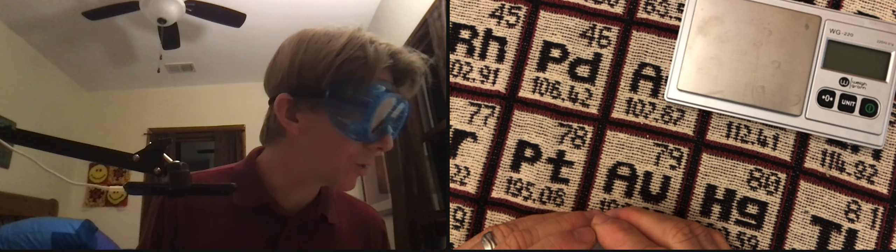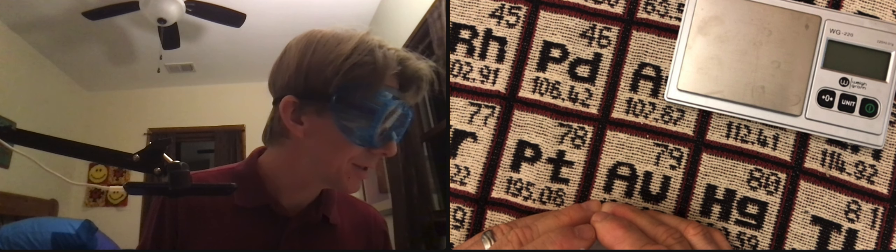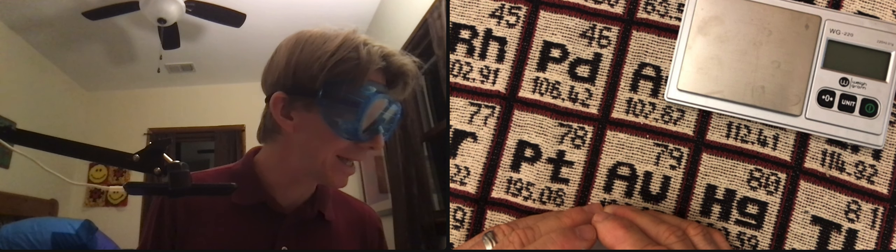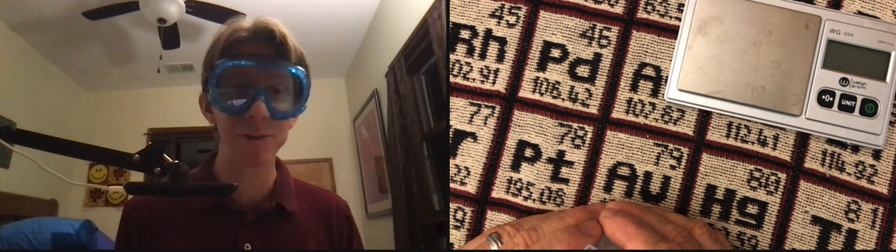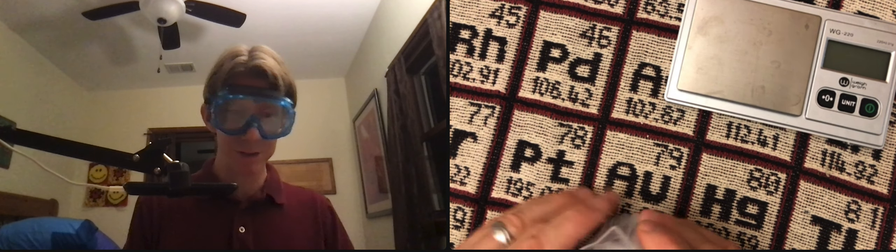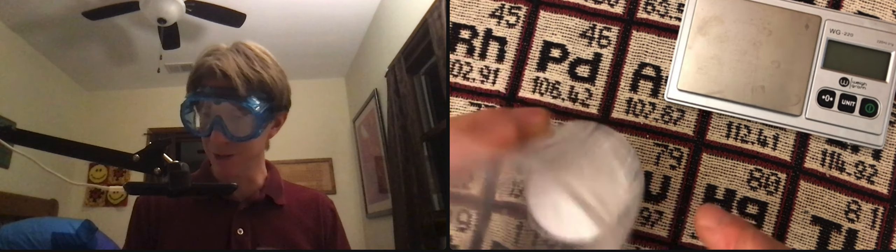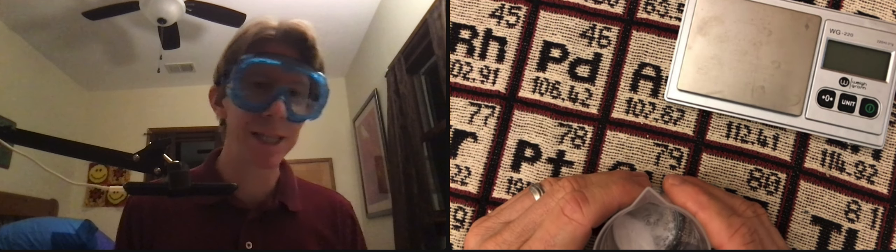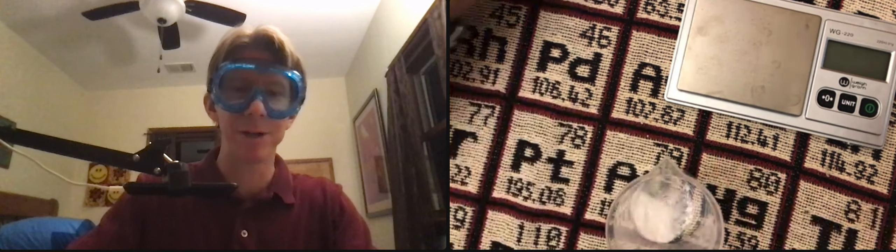And what I did not say is that I need to add 25 milliliters of water to this. So I'll add 25 milliliters. I'm going to stir this for five minutes and then I'm going to let it sit for 24 hours as well.